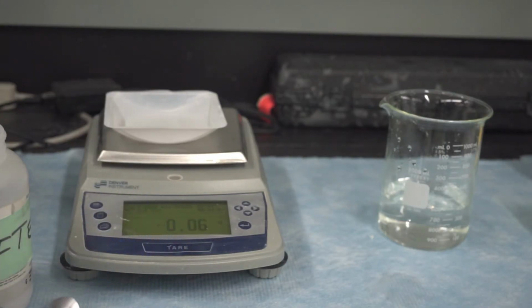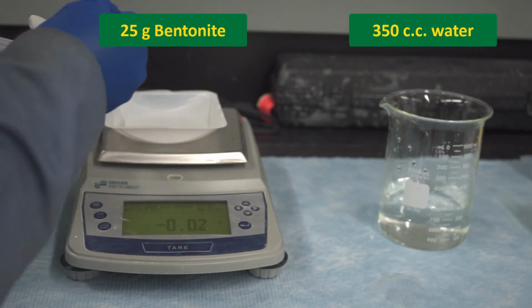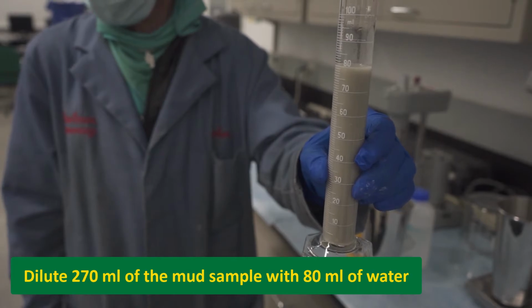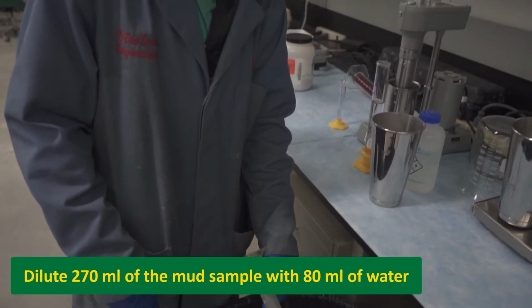Now that those tests are done, prepare a second mud again by mixing 25 grams of bentonite and 350 cc's of water. Dilute 270 milliliters of this mud with 80 milliliters of water and convert to lime as follows.